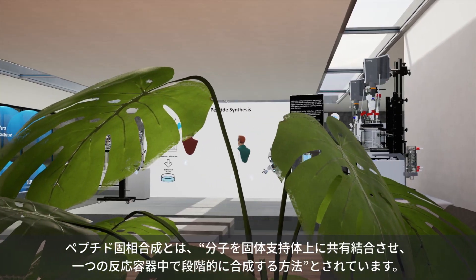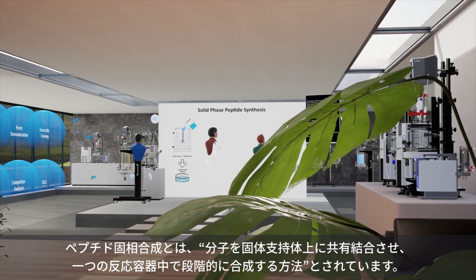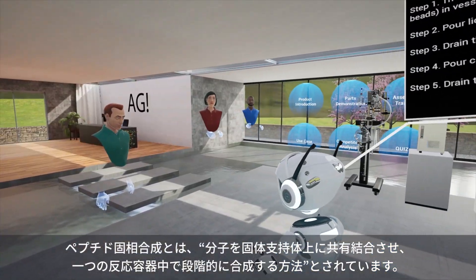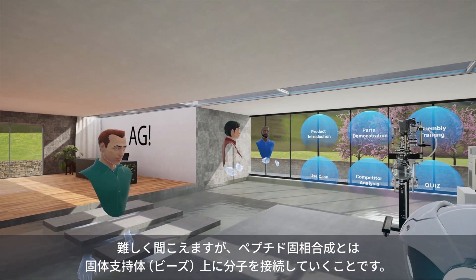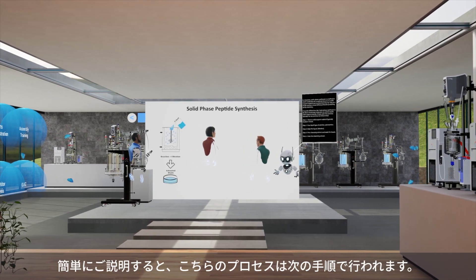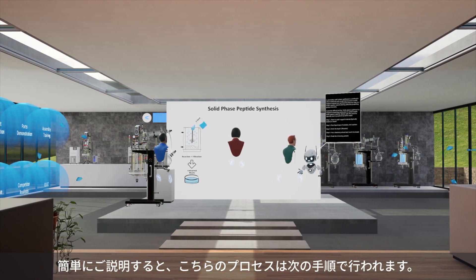In chemistry, solid phase synthesis is a method in which molecules are covalently bound on a solid support material and synthesized step by step in a single reaction vessel utilizing selective protecting group chemistry. It sounds difficult, but solid phase synthesis is all about connecting molecules on certain beads solid support material. Simply said, this process typically can be practiced in the following steps.